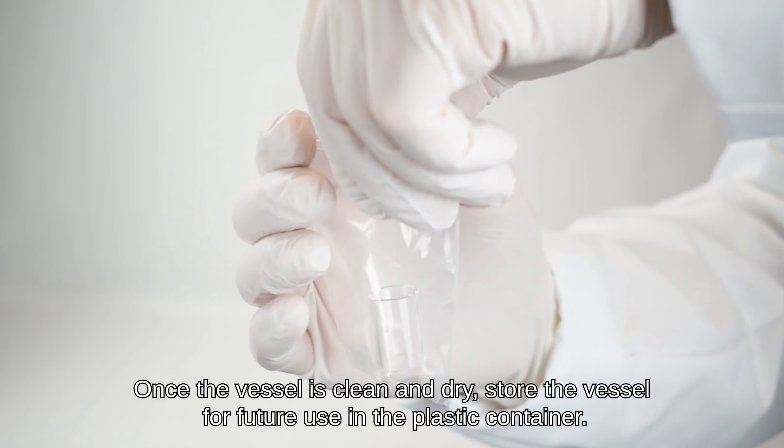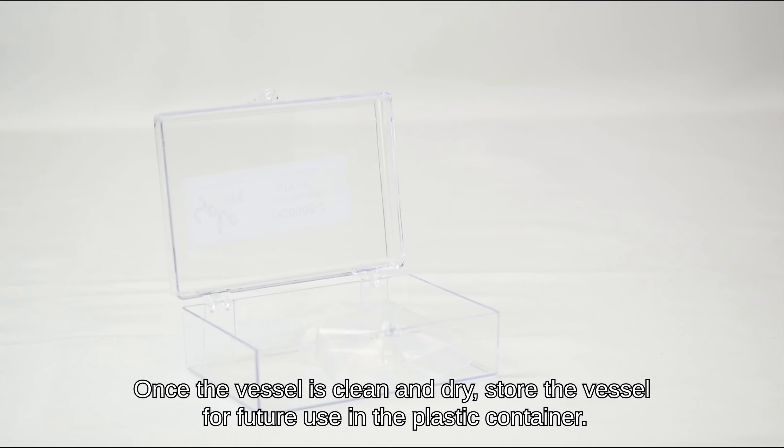Once the vessel is clean and dry, store the vessel for future use in the plastic container.